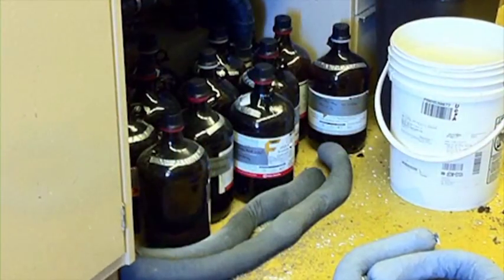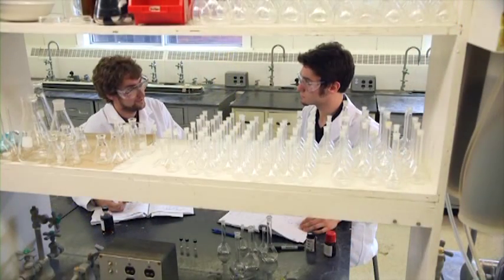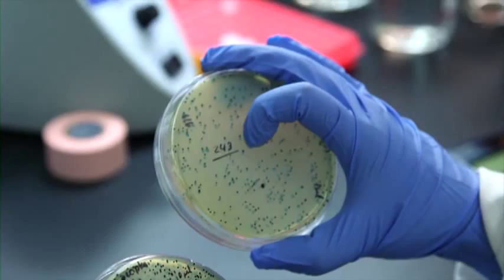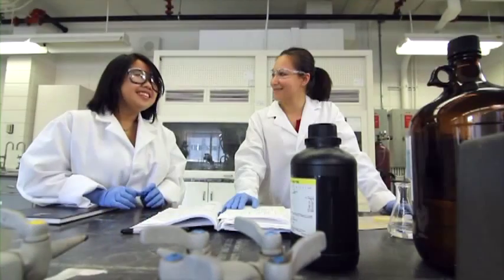These types of incidents are graphic reminders of how serious fire can be. Every member of a lab must be aware of the potential hazards of the material they are working with and take steps to ensure the safety of both themselves and the people they work with.